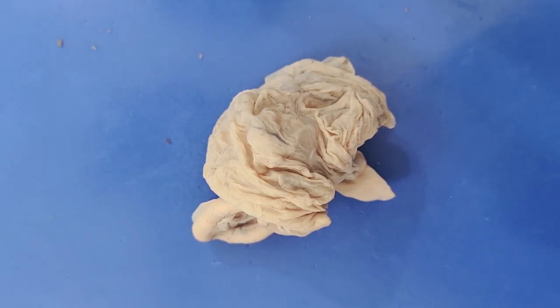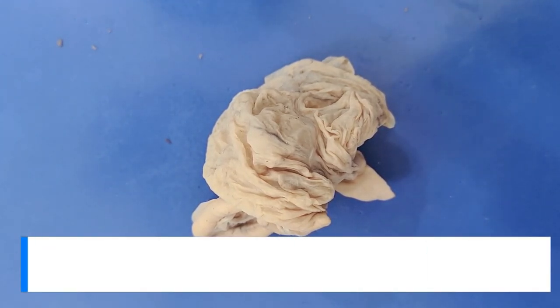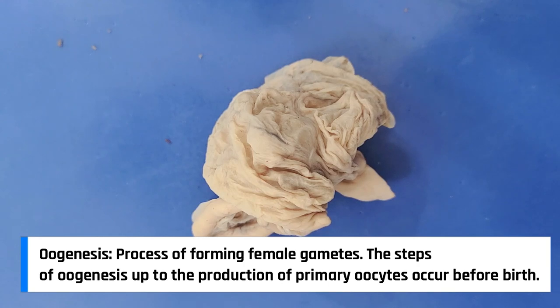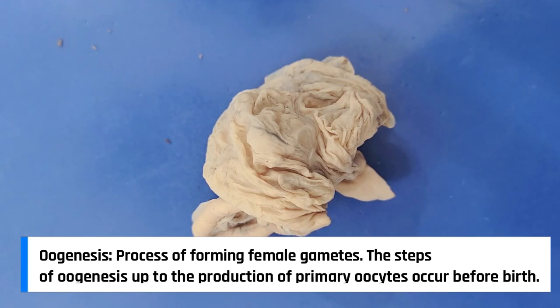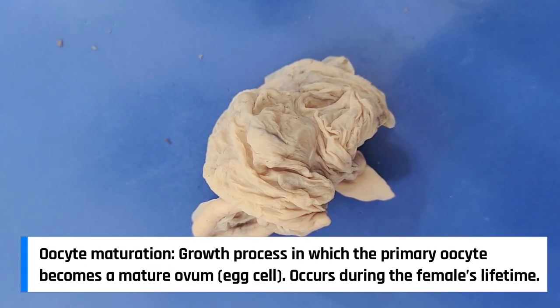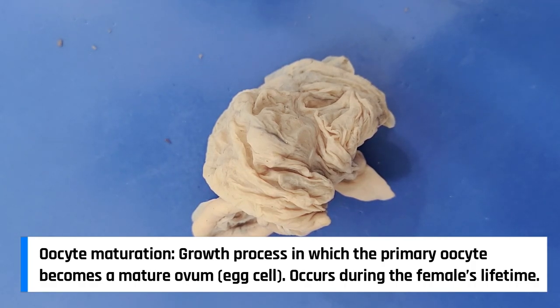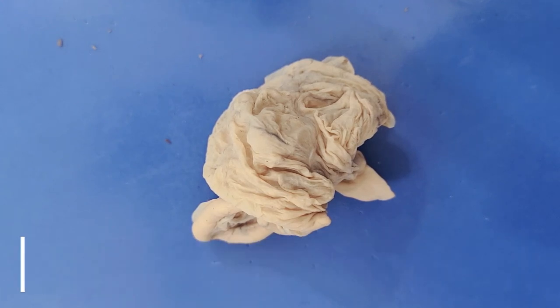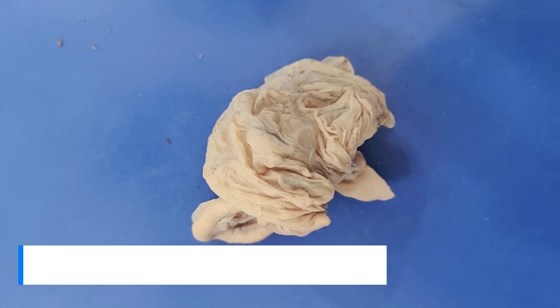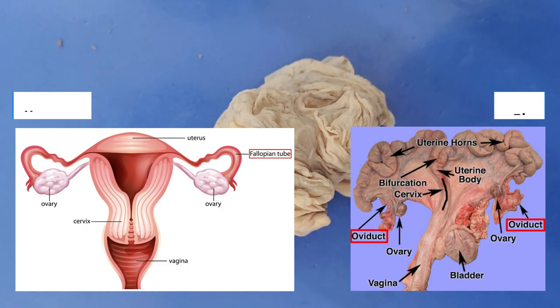Egg production takes place over several steps. First is oogenesis, which refers to the production of gametes during fetal development before the organism is born. Second is the maturation of the oocyte, which takes place over the female's lifetime. After an oocyte is mature, comes ovulation, where the mature oocyte is expelled from the ovary. After this, the oocyte enters the oviduct — in the case of pigs — where it is fertilized.